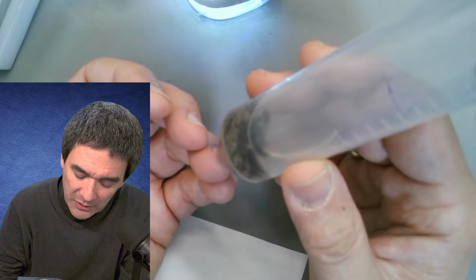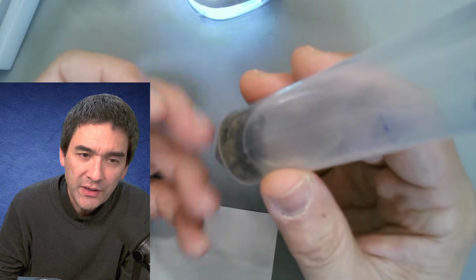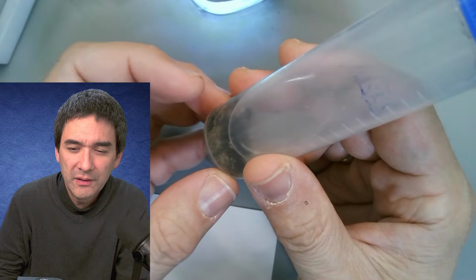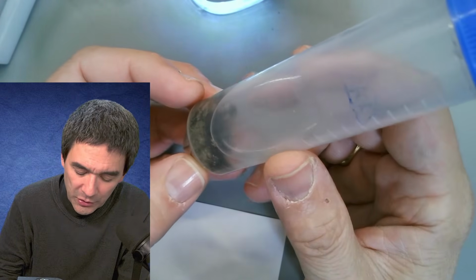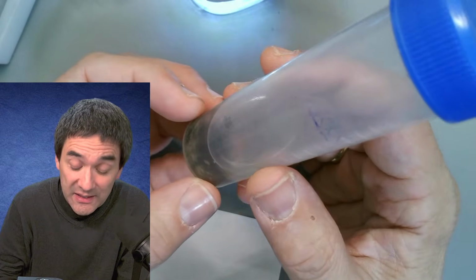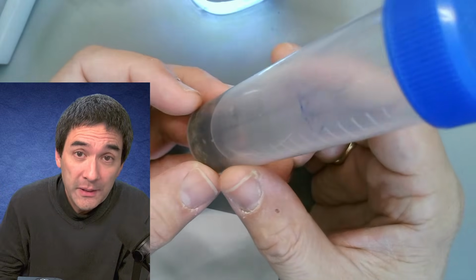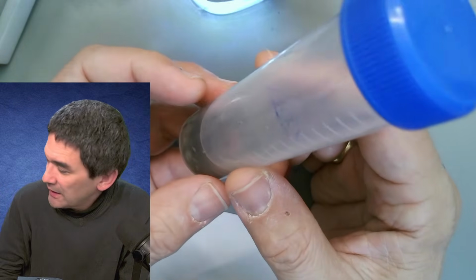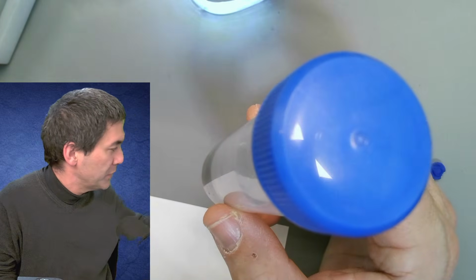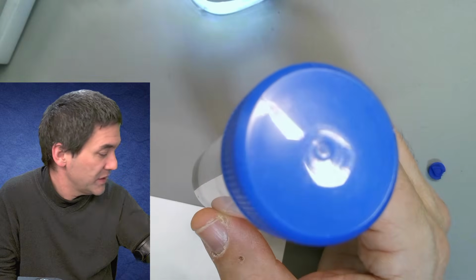And in order to purify them and to get clean diatom shells, I have to digest everything away that is organic here. Okay, so let me focus it. And in order to do that, I'm going to add a fairly concentrated hydrogen peroxide, and this is a little bit dangerous, because if you get hydrogen peroxide on your skin, or heaven forbid into your eyes, this is not something good. And I've seen that I still have over here a little bit of 30% hydrogen peroxide in the bottle. I've got some 3% over here as well.